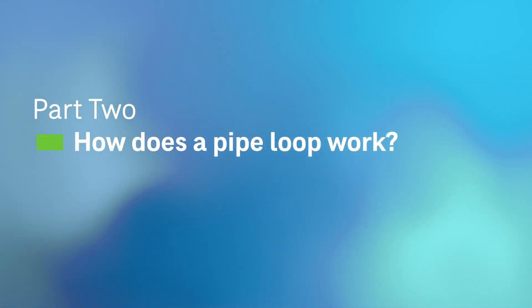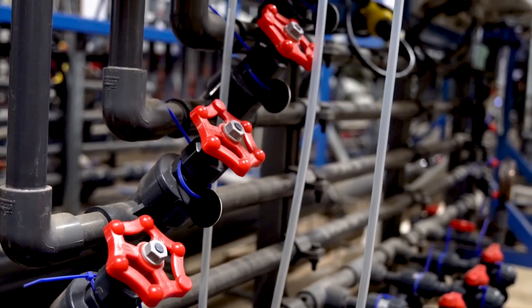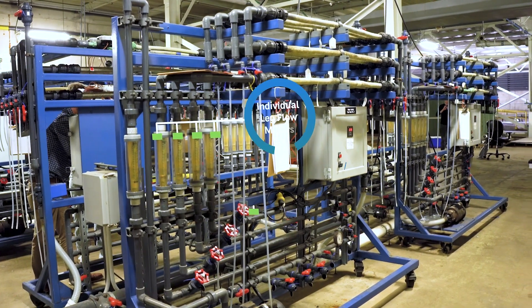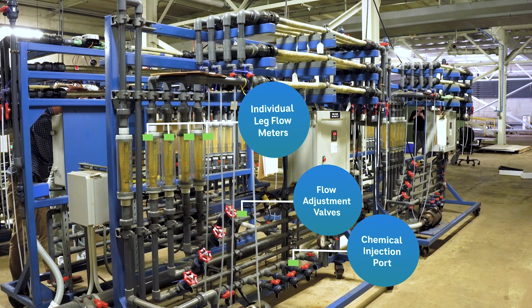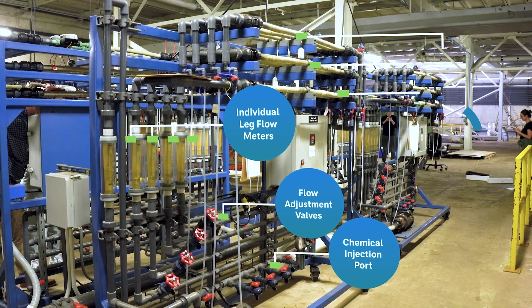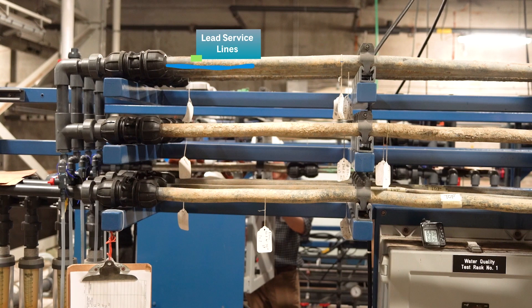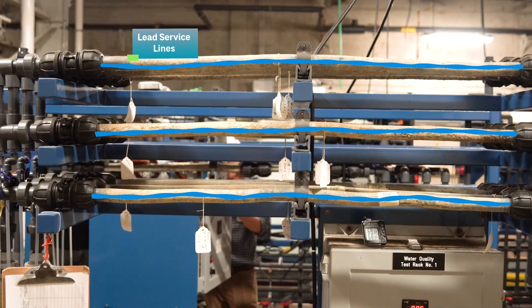Here's a typical pipe loop skid. Main components include a booster pump, flow meters, flow adjustment valves, chemical injection ports, and the test material. After water enters the pipe loop, it goes through a total flow meter, then passes a chemical injection port where we can inject chemicals and make adjustments to the water chemistry. After that, it is split into separate replicate legs, each with an individual flow meter so we can measure and adjust flow per leg. It then flows through the test materials — here we have lead service lines, but they can be any lead-containing material used in plumbing, such as leaded brass or copper with lead solder.